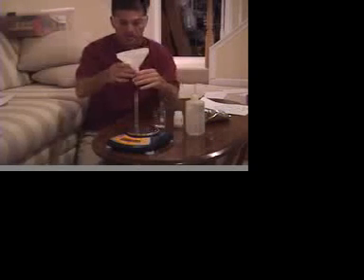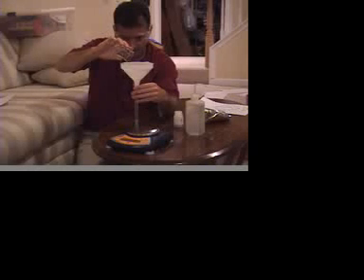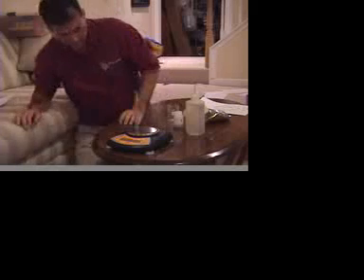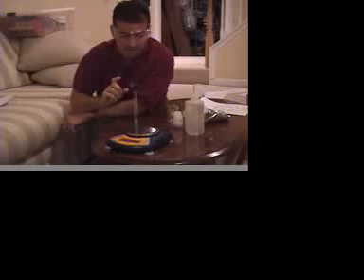So what we need to do now, now that we've got that 4.8 recorded in the lab, is use a funnel. Carefully pour in all of your tin shot. You have to make sure you get all of it in because that's the mass that you use. So you have to find the volume of the mass that you use. Now, the water's obviously gone up. So you're going to measure that again. This is 6.7 milliliters.